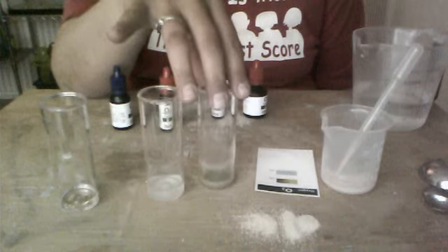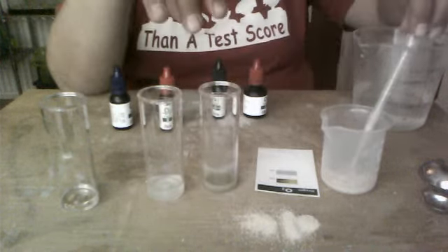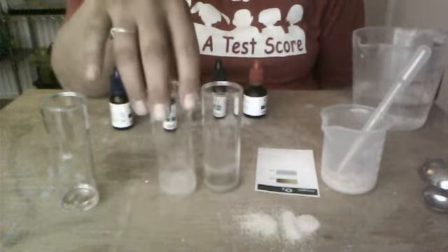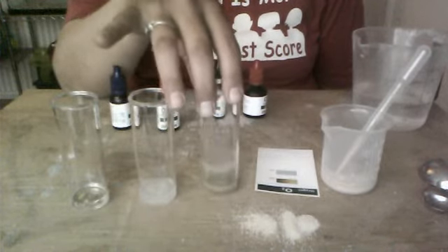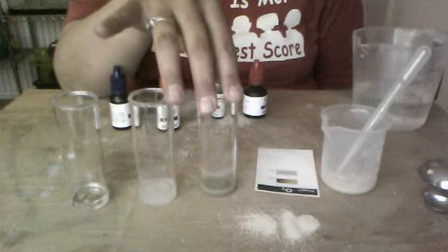And what I had done was added 20 drops of the yeast solution to 6 milliliters of water, the same amount of water as phase 2 and as phase 1. So now there's more organisms in the same amount of water. They're obviously going to be consuming more oxygen and producing more waste.